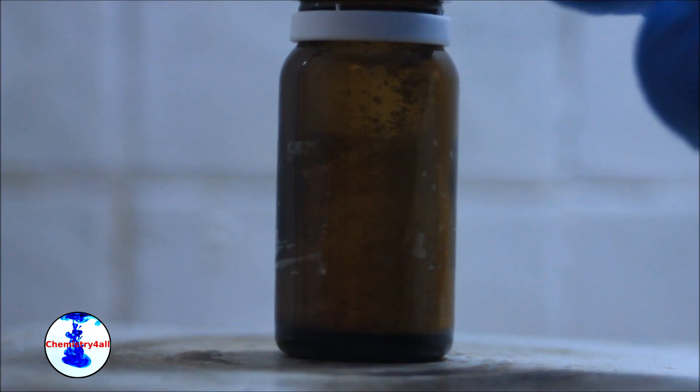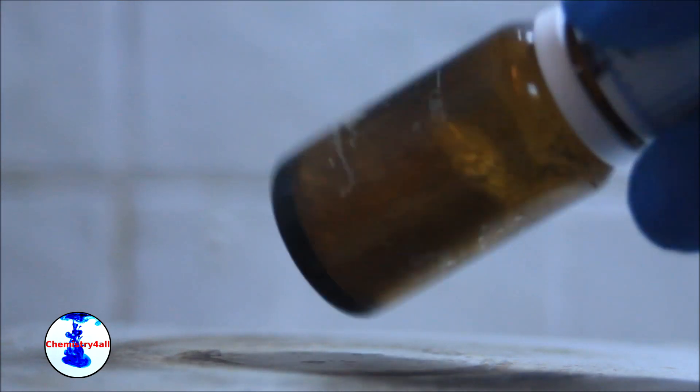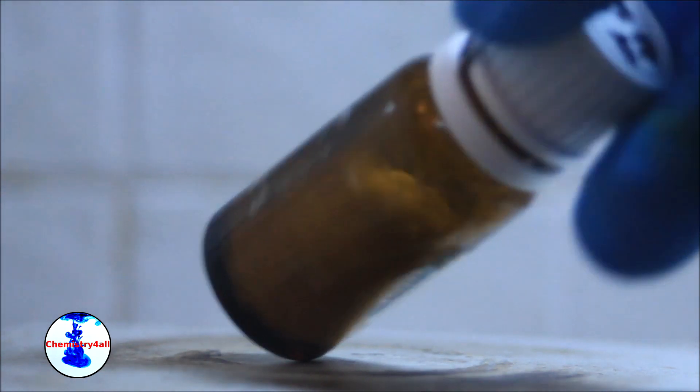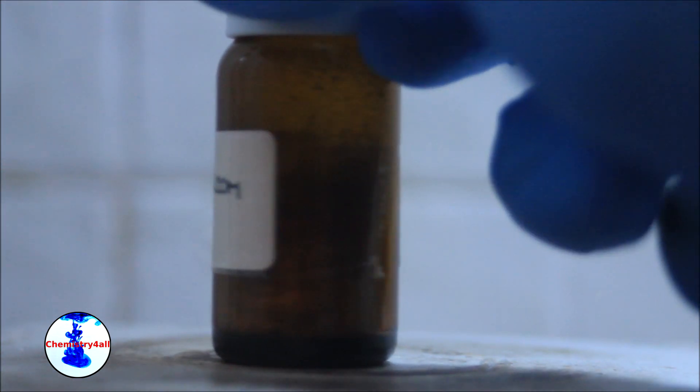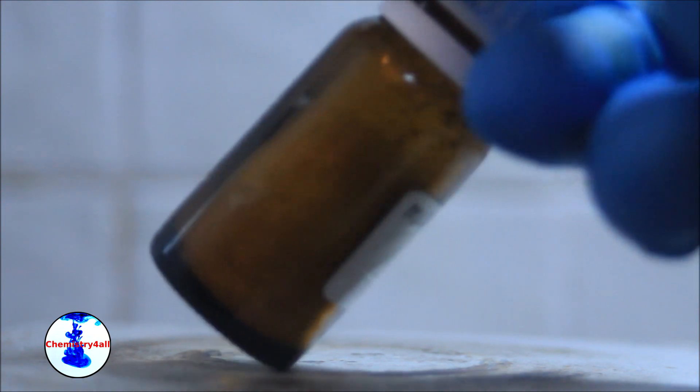At the end, I have obtained a total of 1.63 grams of pure benzoic acid, which represents a 42% yield. This result is in accordance with the one described in the literature.